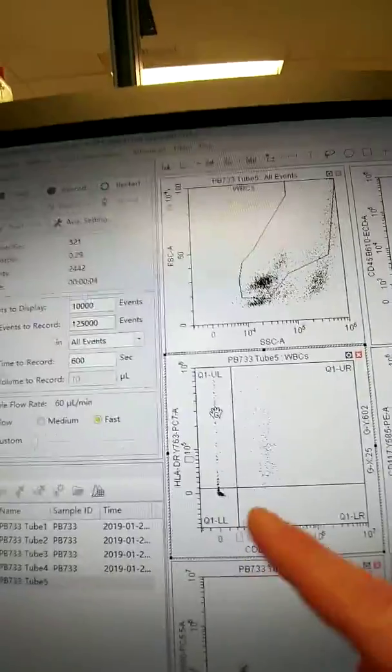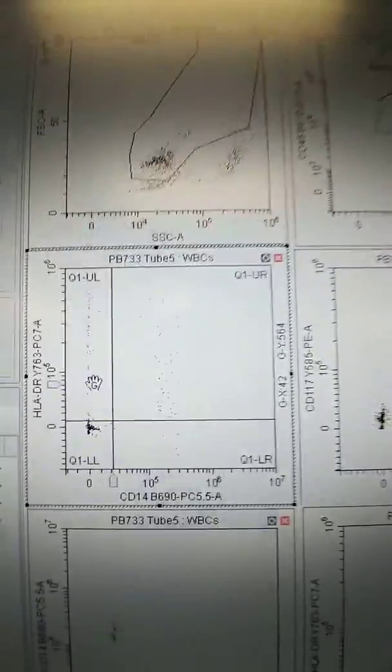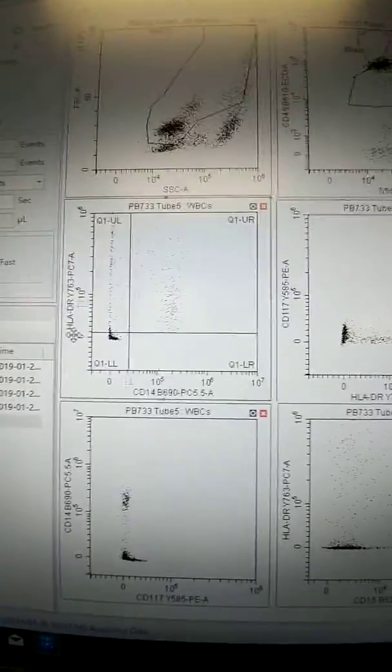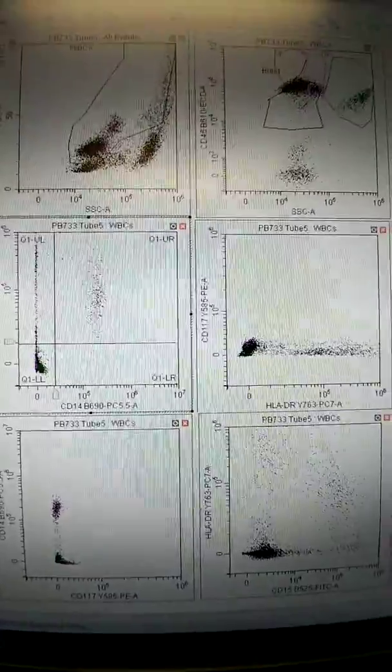Okay, and you see there's a line here now, diagonal. When you adjust gains, it also will affect your compensation value some. It still looks pretty high, so let's go a little bit more. Oops, that's too much probably, so let's hit this. Oh, we can't undo. What we can do though is just go up a little bit instead. Okay, and let's go out here and click outside the histogram to release it. And let's adjust this here a little bit. There's that. Okay. Still looks like maybe we're cutting some off. Bring it just a little bit more.